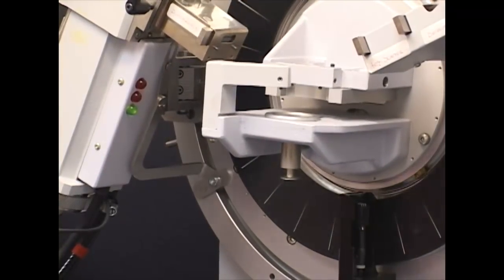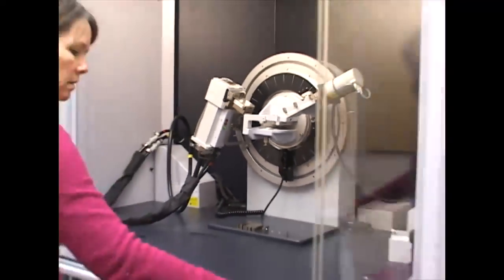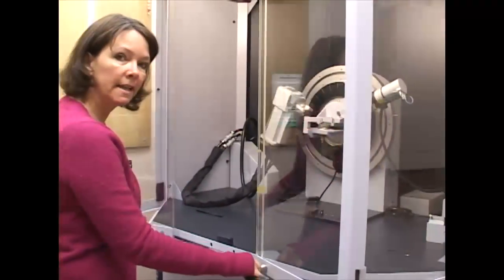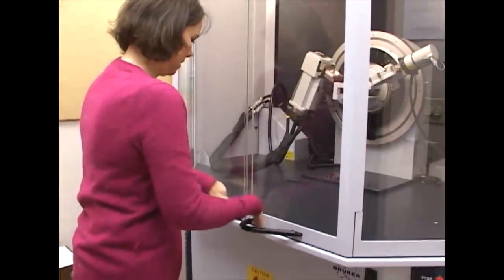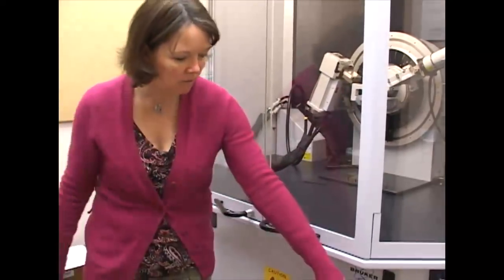When your sample's been removed, you can close the doors. No need to slam them. Verify the door's closed by checking the alarm light and you're finished.